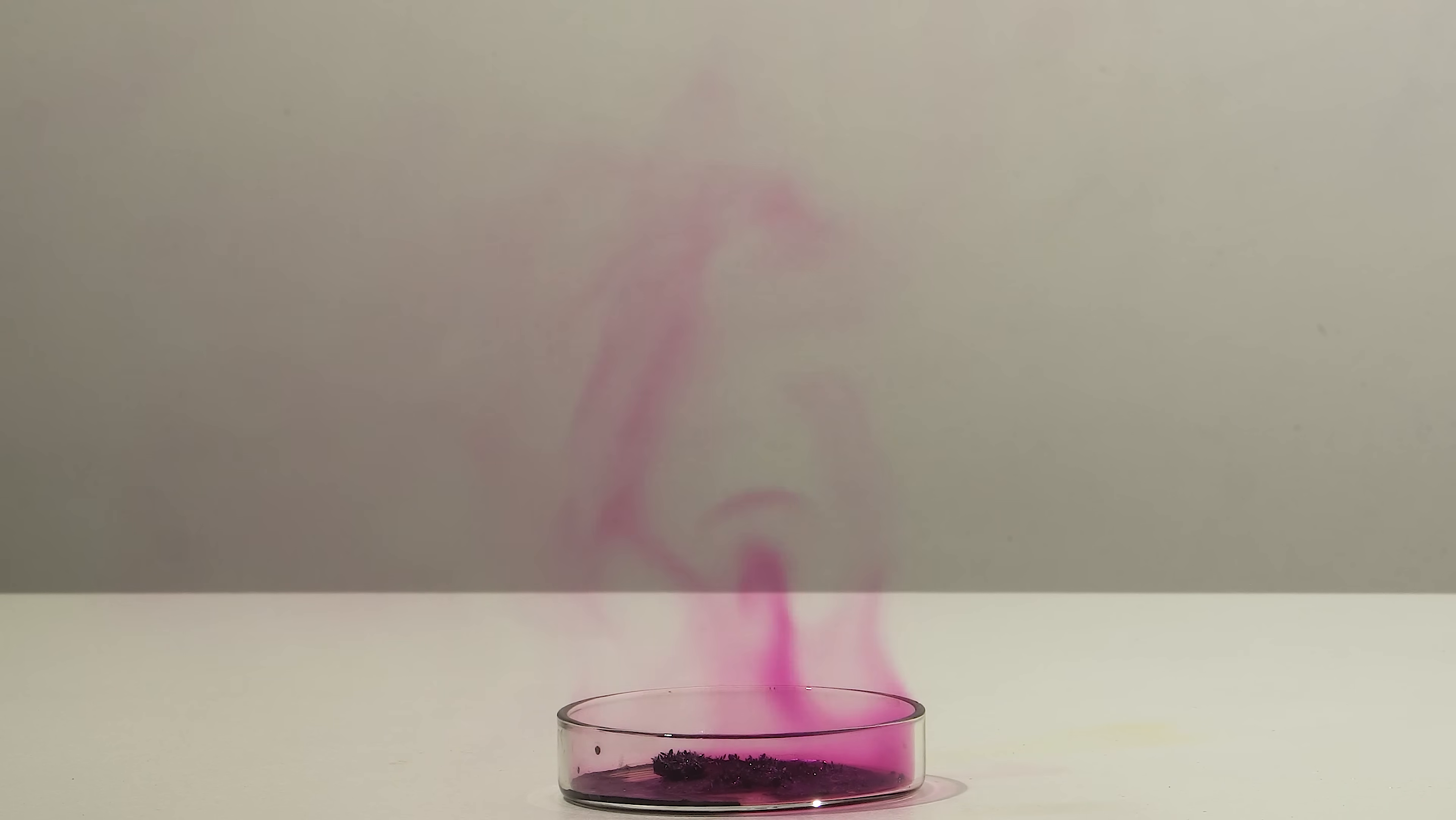And here I tried to pour pyrophoric lead into heated iodine. It didn't turn out very impressive. The first attempt didn't manage to get the petri dish with heated iodine.